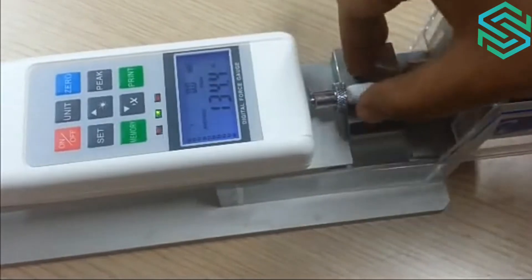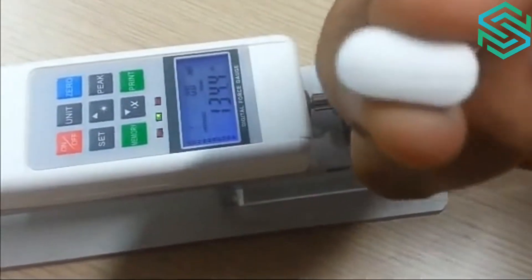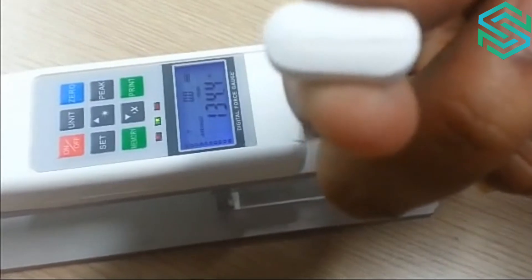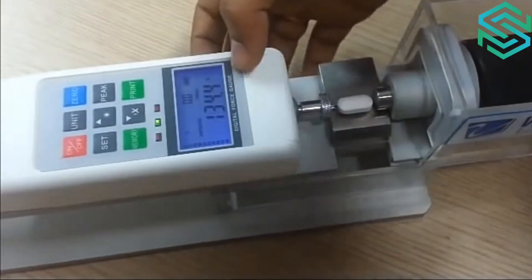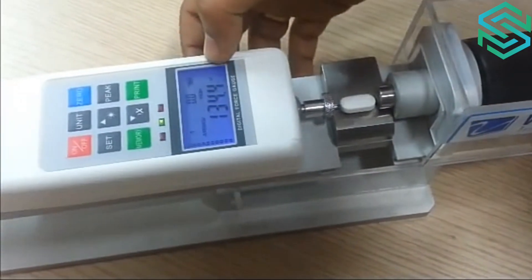Out here you can see the tablet has been fractured. And the force which was applied was 134.4 Newtons.